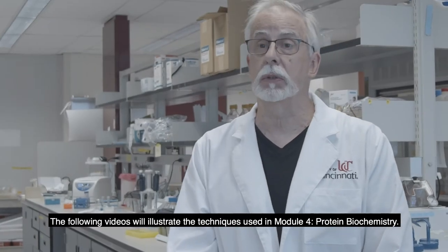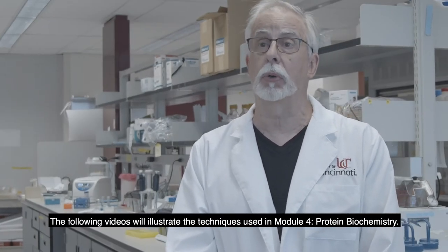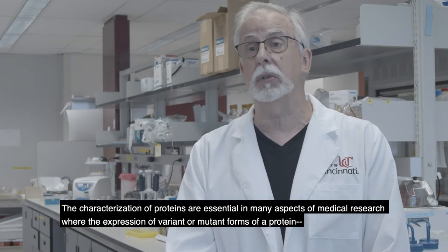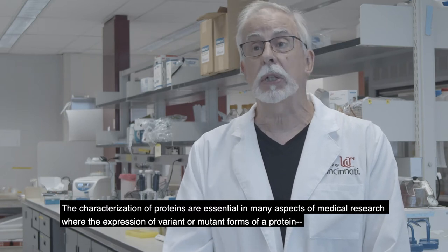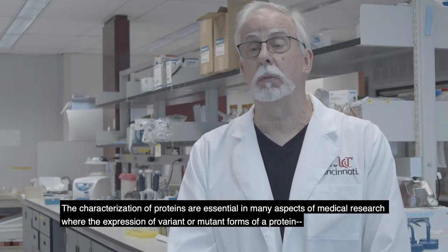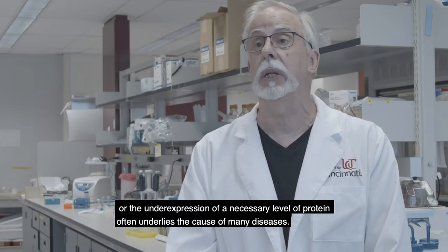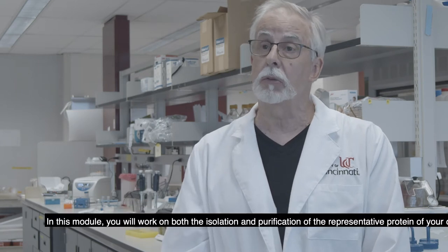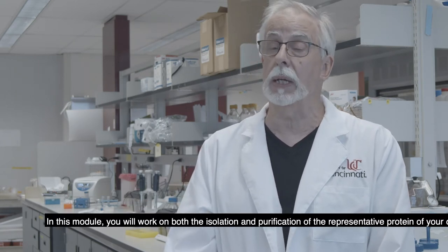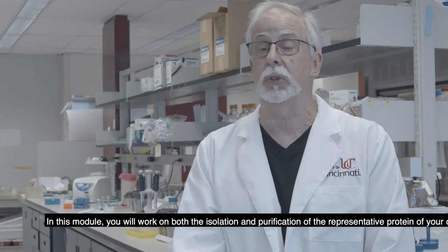The following videos will illustrate the techniques used in Module 4, Protein Biochemistry. The characterization of proteins is essential in many aspects of medical research, where the expression of a variant or mutant form of a protein, or the under-expression of a necessary level of a protein, often underlies the cause of many diseases. In this module, you will work on both the isolation and purification of a representative protein that you're choosing.